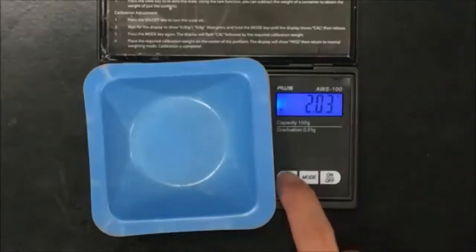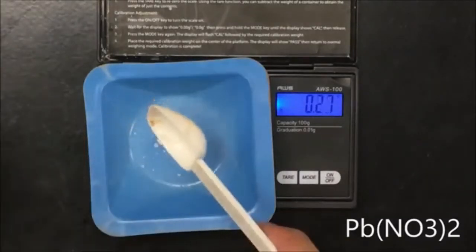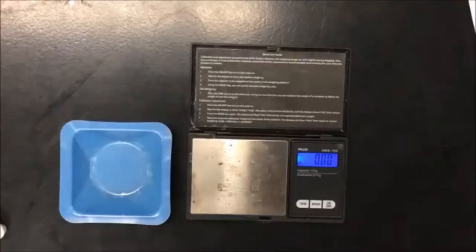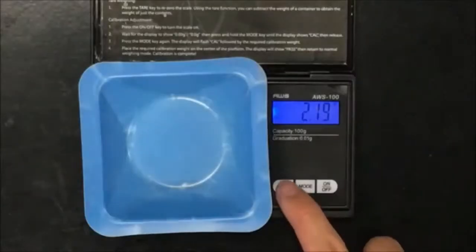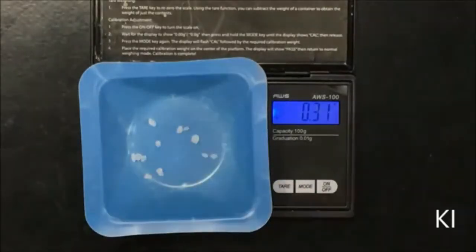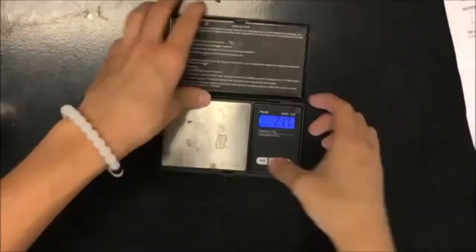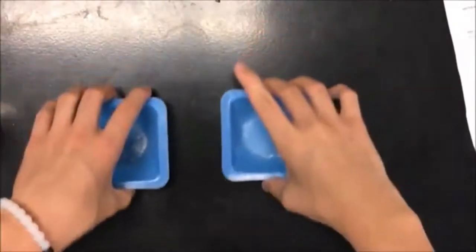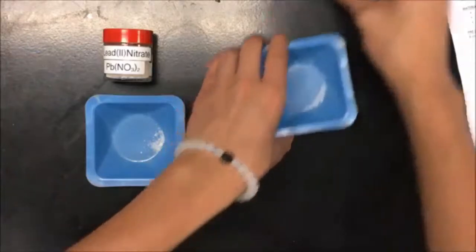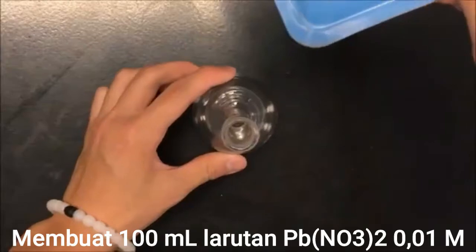To make a 0.01 molar solution of lead 2 nitrate, measure out 0.33 grams. To make a 0.02 molar solution of potassium iodide, measure out 0.33 grams. Now that we measured out 0.33 grams for each compound, we have to make a solution using the 100 milliliter volumetric flask.